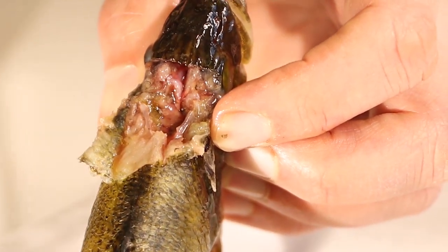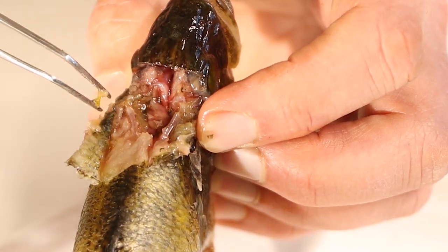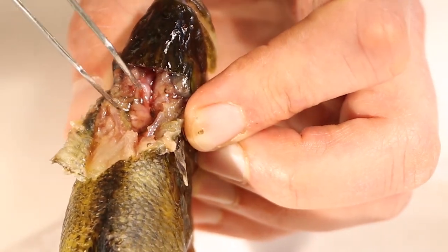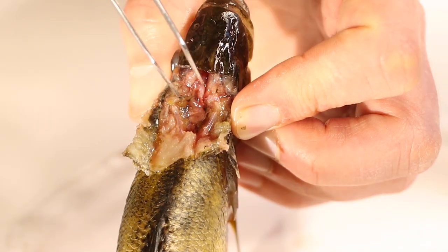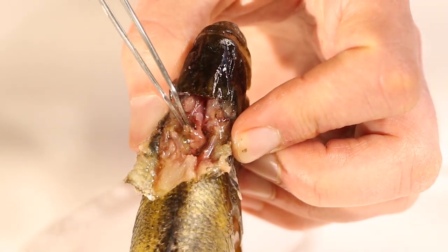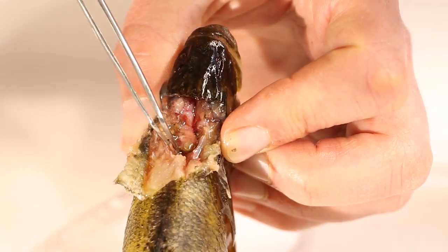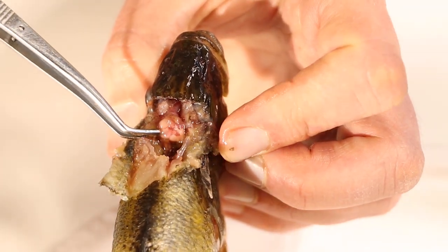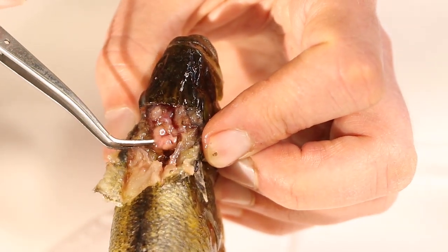This light pink right here is all of the fish's brain. It's not really made of muscle like the other tissue, so we can't just grab it like we did the heart and yank it right out. But we can give it a try. At the front of the brain are going to be the optic nerves, and at the back it's going to run into the fish's spine. This one is getting pretty soft, but we're starting to lift it.